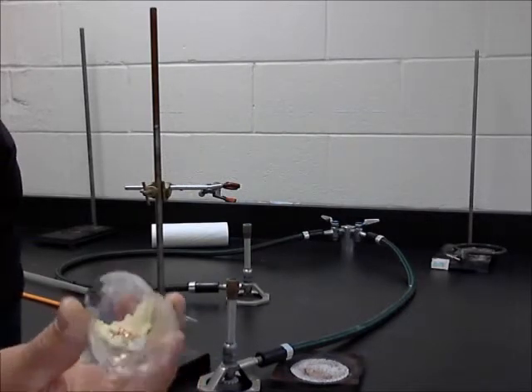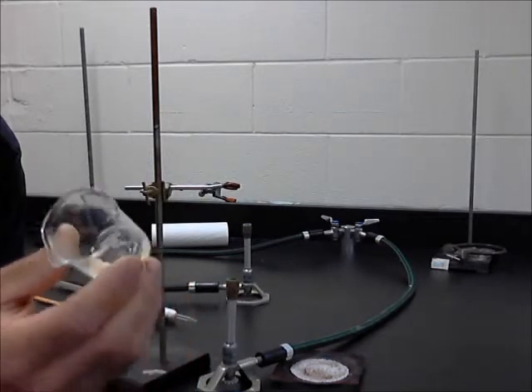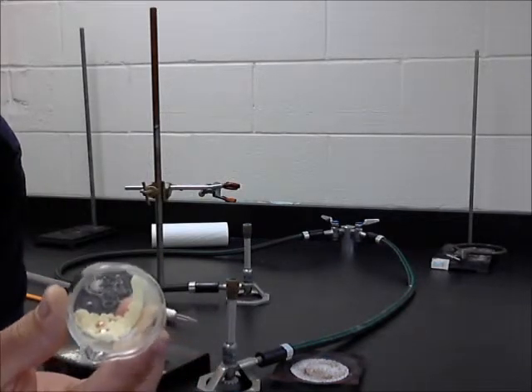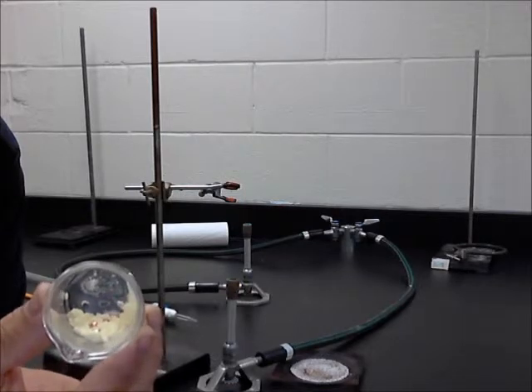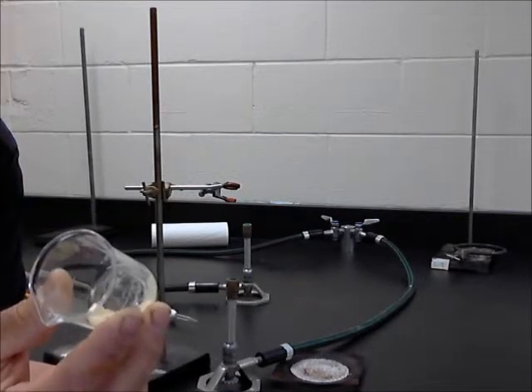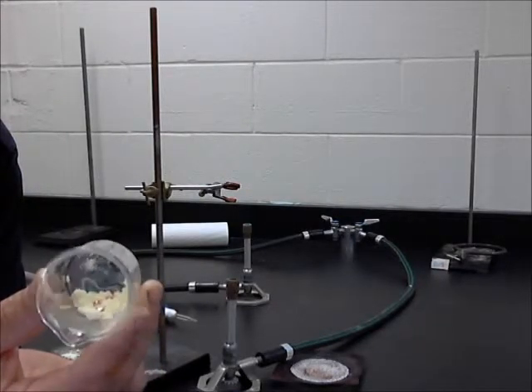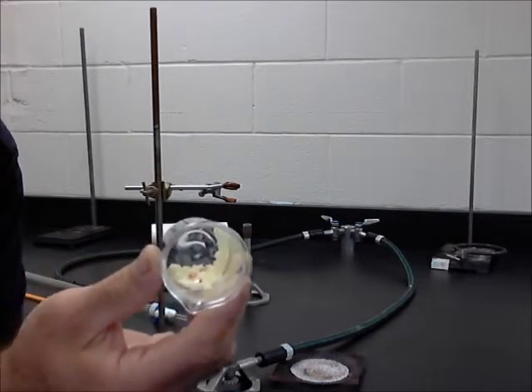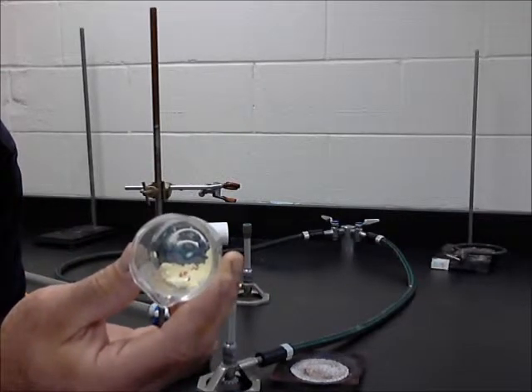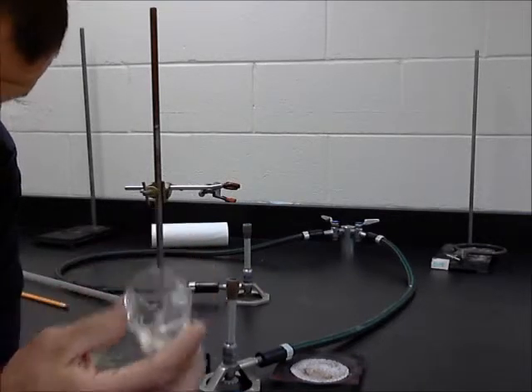You can see that at this point they have mixed together. It says to wait a little bit, but as time goes by, you'll see this is nothing more than what we would refer to as a heterogeneous mixture. More of a physical combination than what would be considered a chemical reaction. No new substance has been formed.